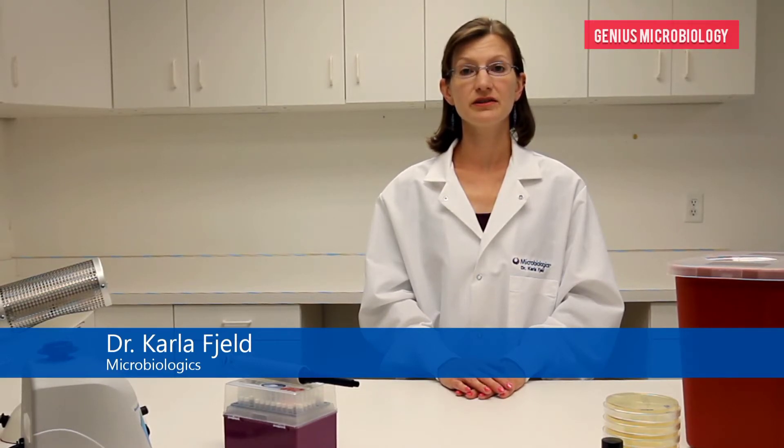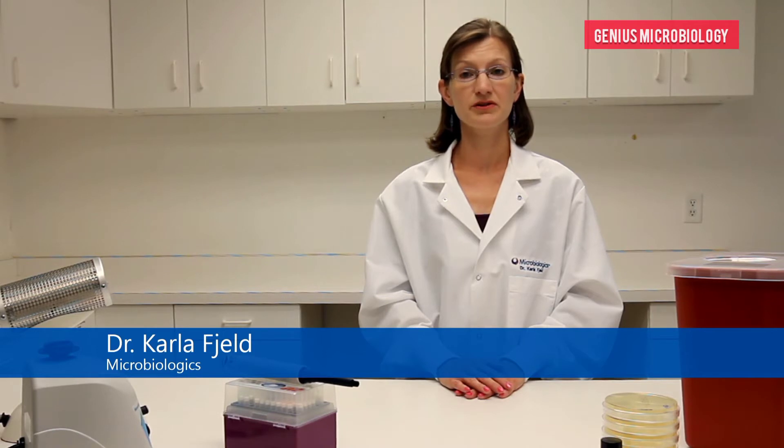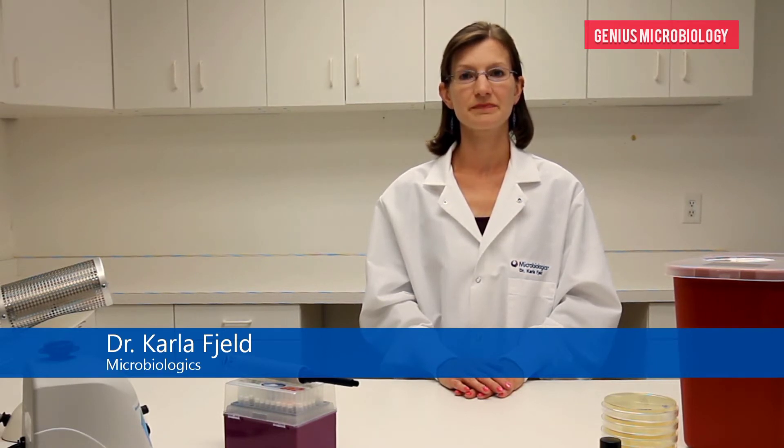In this video, I will explain the serial dilution process and demonstrate how to perform dilutions when using the Microbiologics ePower product.